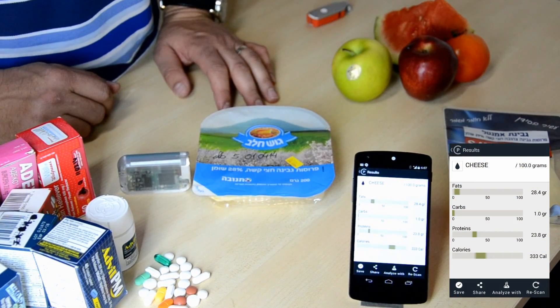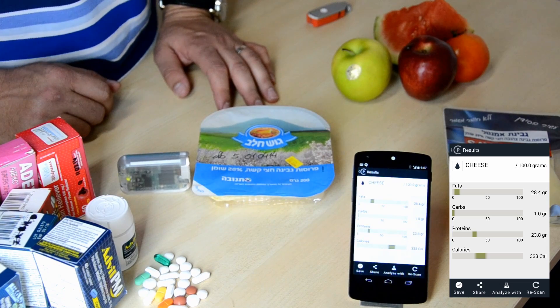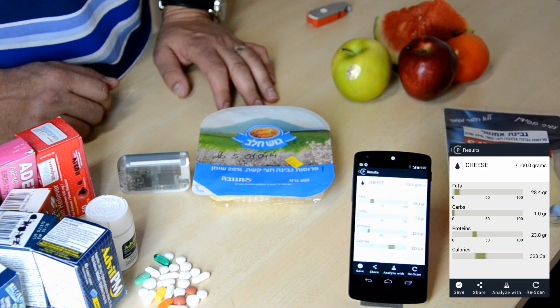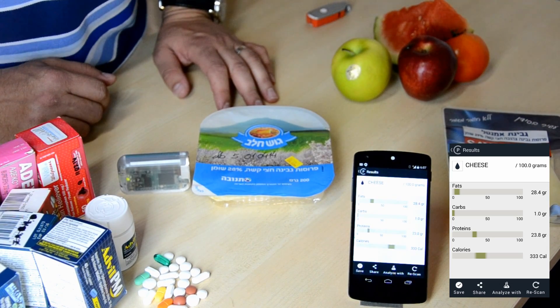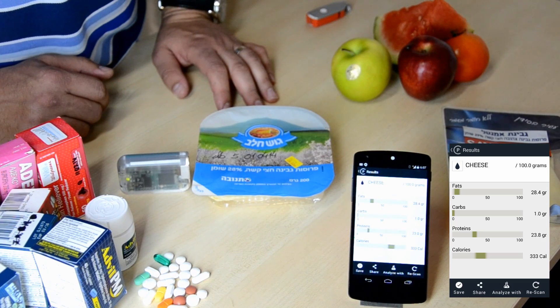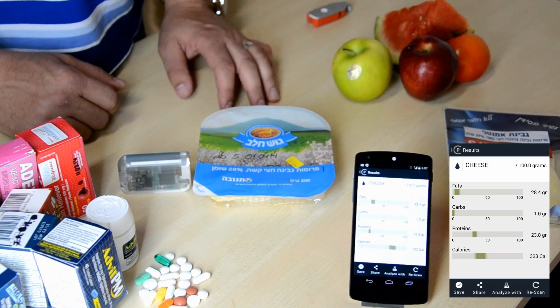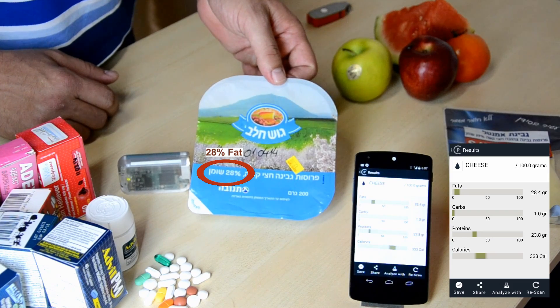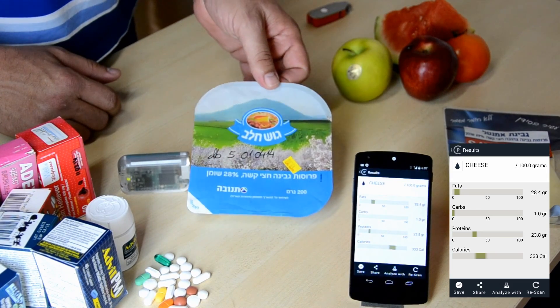You can see it says 28.4 grams per 100 grams of fat, 1 gram of carbohydrates and 23.8 grams of protein, and 333 calories per 100 grams. That matches quite exactly the label on this cheese.